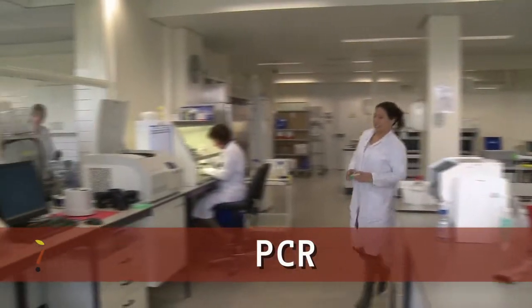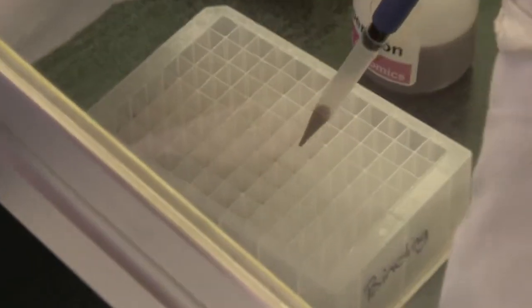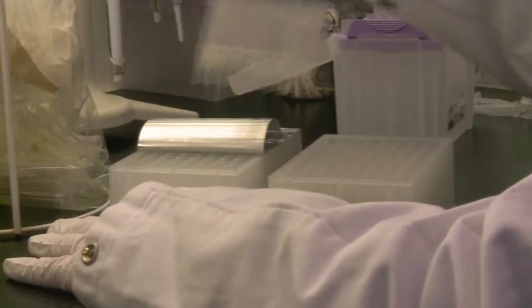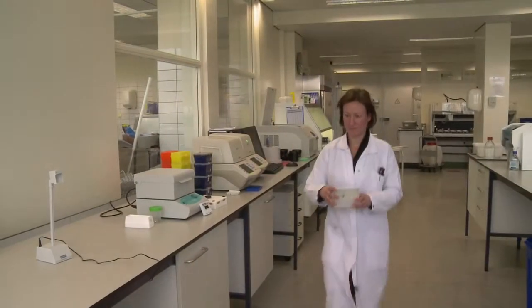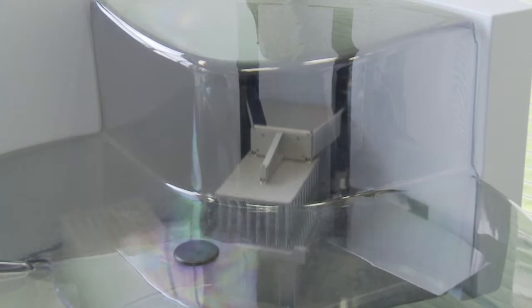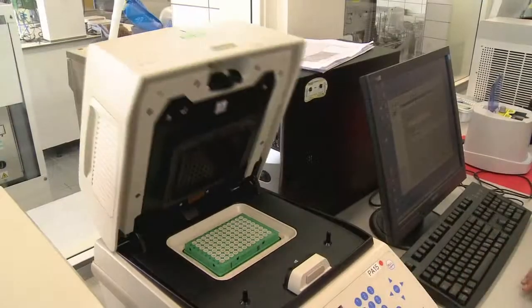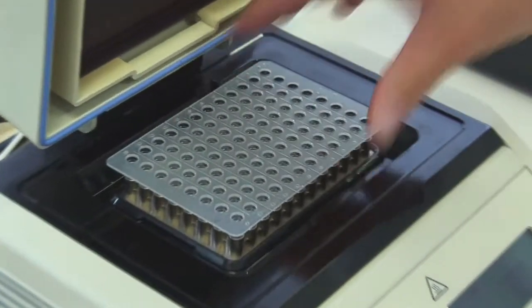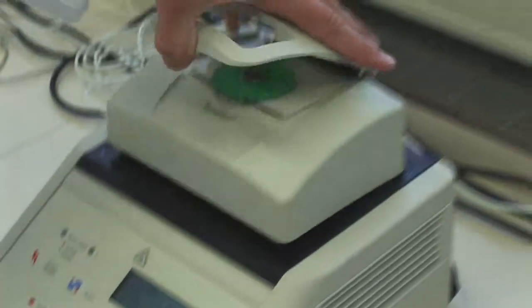The PCR method is applied on a large scale at Naktuinbouw. This polymerase chain reaction is more sensitive than ELISA. It allows detection and identification of low concentration levels of pathogens in seeds, plant material, soil and water. The PCR amplifies a specific piece of DNA from the target organism until there is sufficient to allow analysis. To conduct the PCR, two primers are selected that match a complementary DNA sequence of the target pathogen. The right combination of primers is specific to the pathogen you wish to identify.